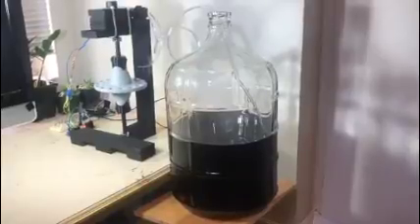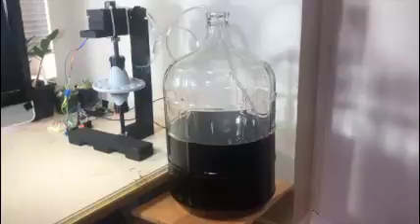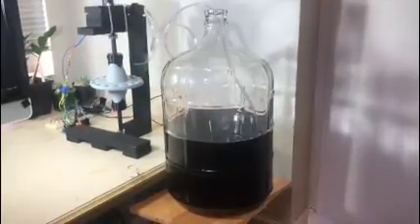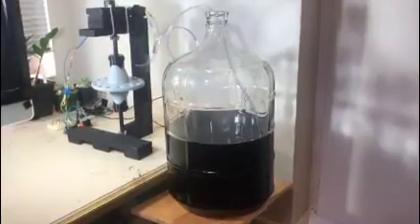Normally the device would be placed in a shell, as the yeast needs total darkness to be detected, but here it's opened to be able to see inside. In addition, test tubes and yeast would be included on the rotor if measurements were actually being taken.